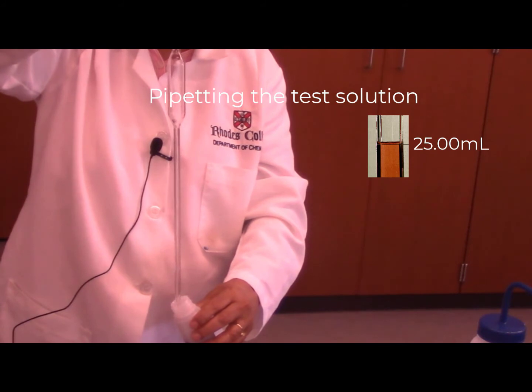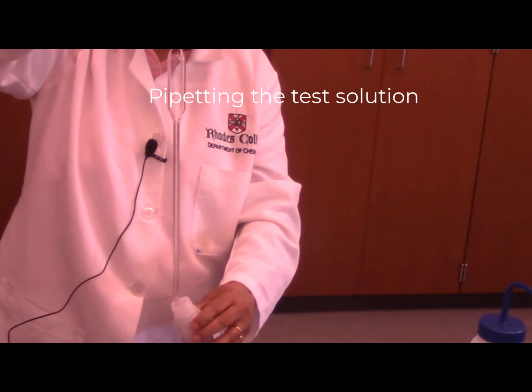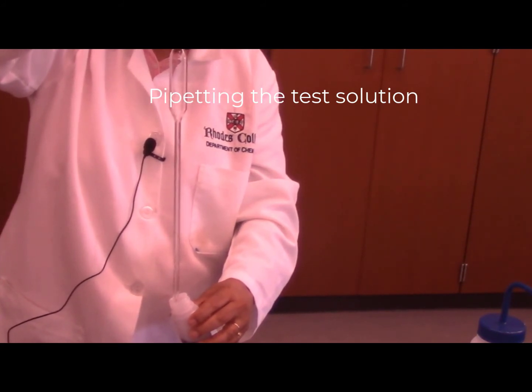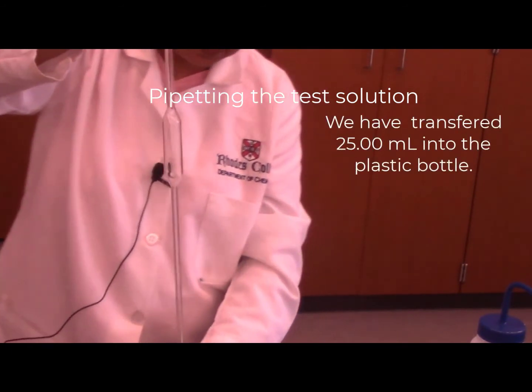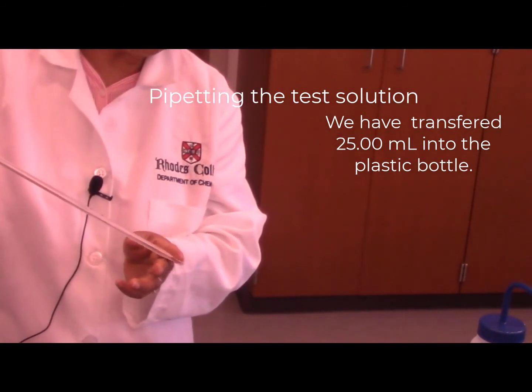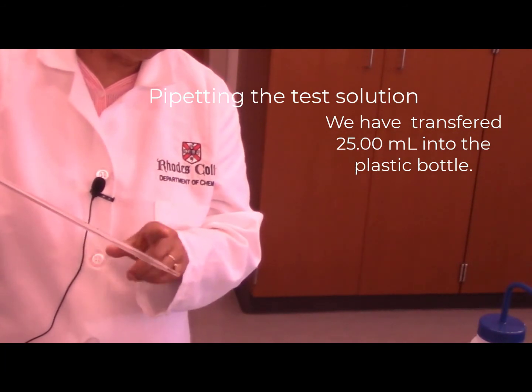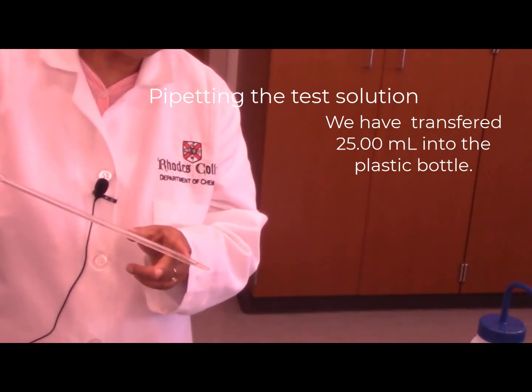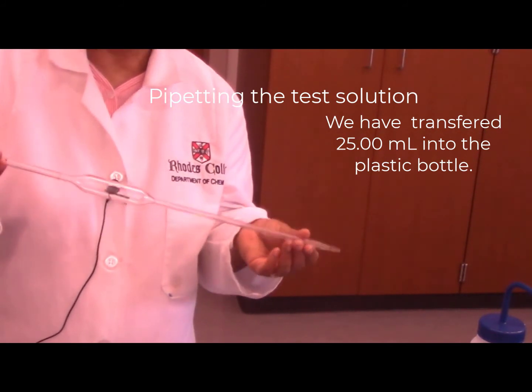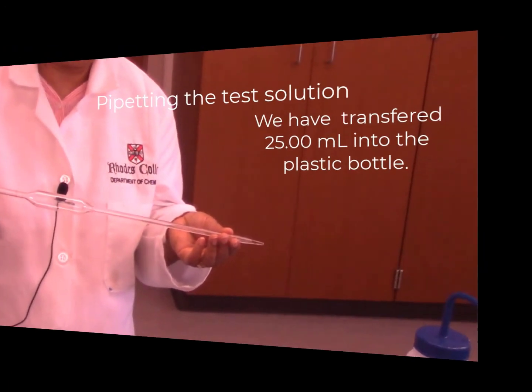Now almost all the liquid has been transferred into the plastic bottle. We want to be a little patient here to make sure everything is transferred into the bottle. Now you will see that there is a little bit of liquid trapped at the tip of the pipette, and it's okay. We do not want to try to get that liquid into the bottle because the pipette is calibrated to retain that small amount of liquid at the tip of the pipette after delivering 25 milliliter of liquid.